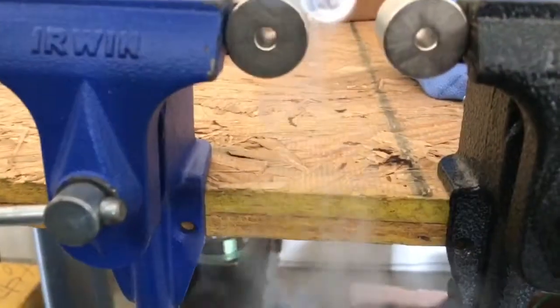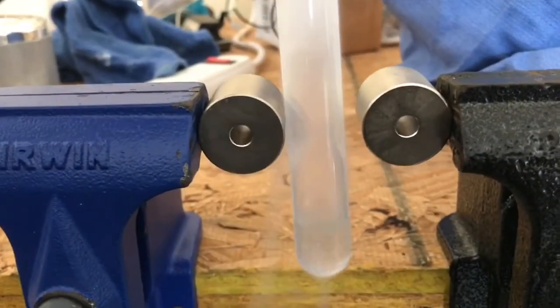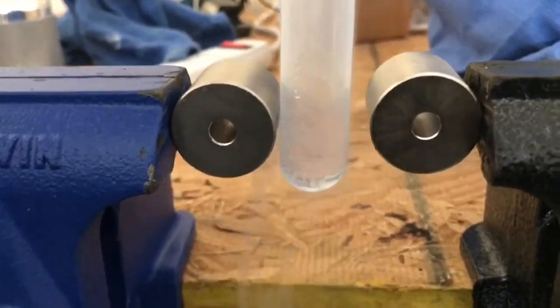Here it goes. Blue liquid. Here it goes. You can see how it sticks. It's been carried off the tube.